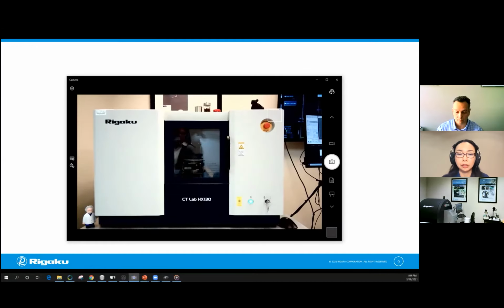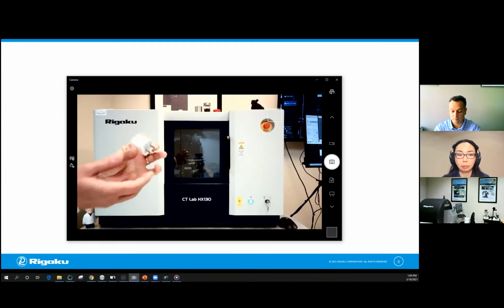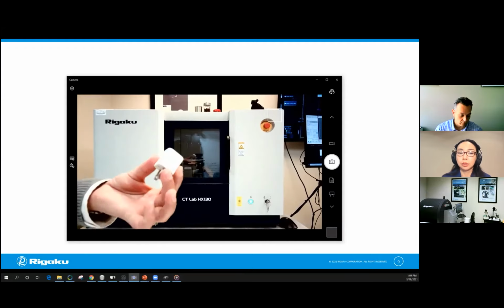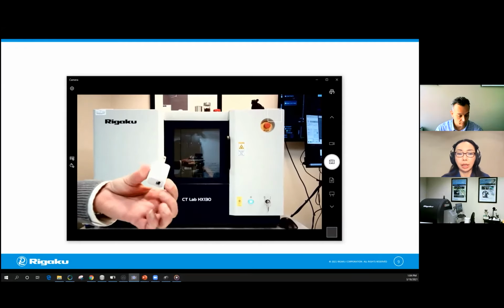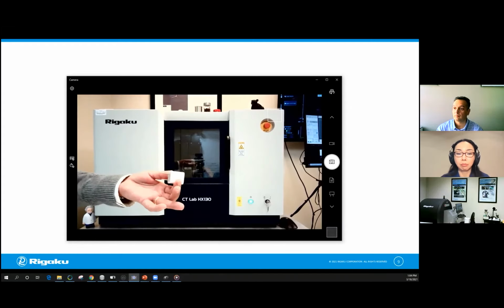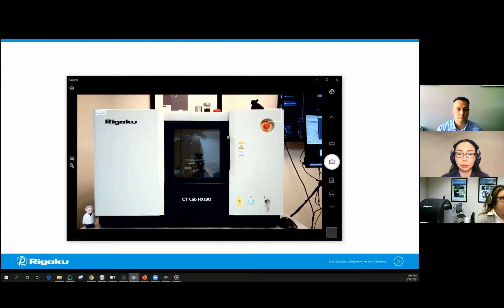Okay, so Angela is going to get the first sample, which is this Apple plug. So let's think about what condition we should be using to scan this sample, which is a combination of a plastic and some metal parts inside. So instead of Angela showing you what we should be doing, I'm going to ask you a question. So let me start the polling.